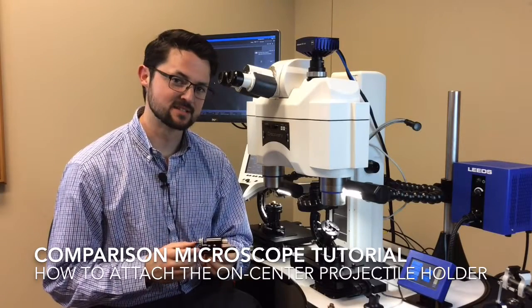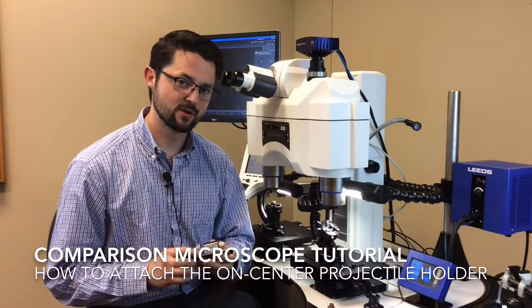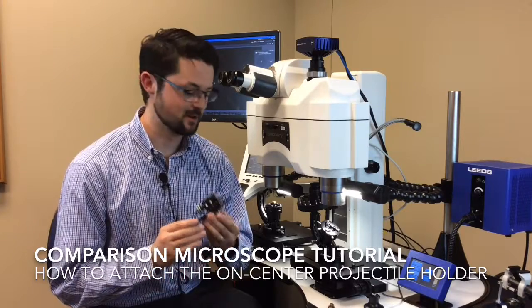Hello, my name is Jake Kurth. I'm with Leeds Forensic Systems. Today we're doing a quick video tutorial on how to use our on-center projectile holder.